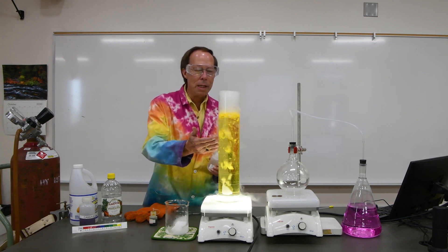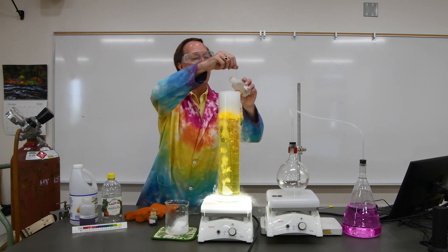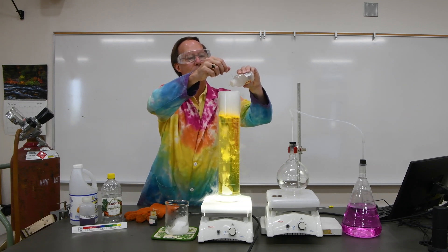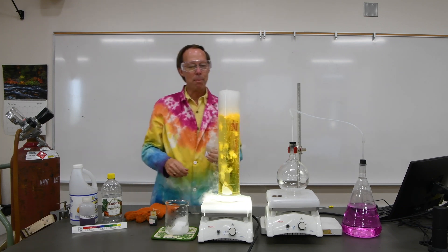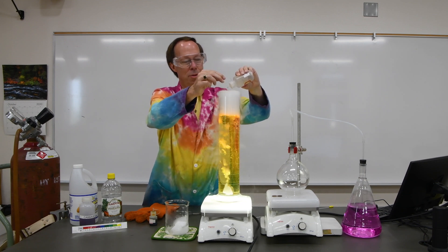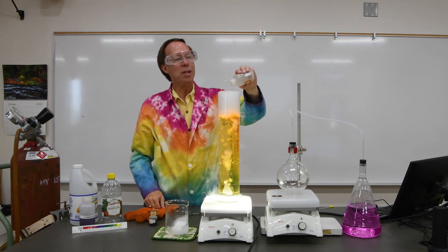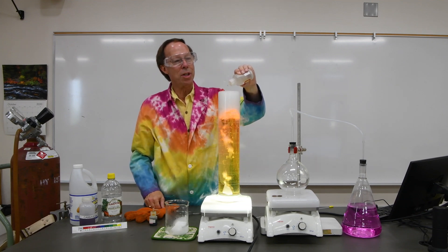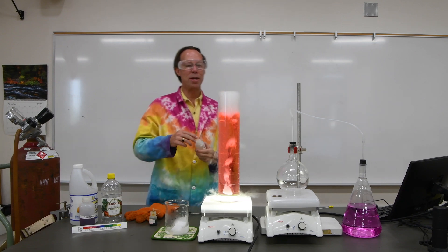you can already see the yellow is beginning to get a bit of a more golden tinge. Let's go ahead and add a few drops of hydrochloric acid. There we go — it gets a bit of a more amber color now. It's hard for carbon dioxide to push the color that far, but if we add some hydrochloric acid we can see the full range that you can get with universal indicator. Eventually, if we add enough acid, it turns that lovely rose color.